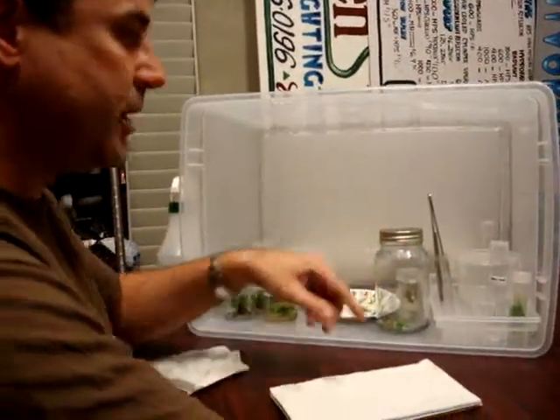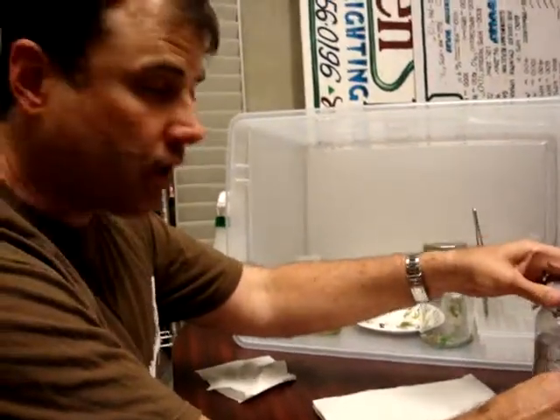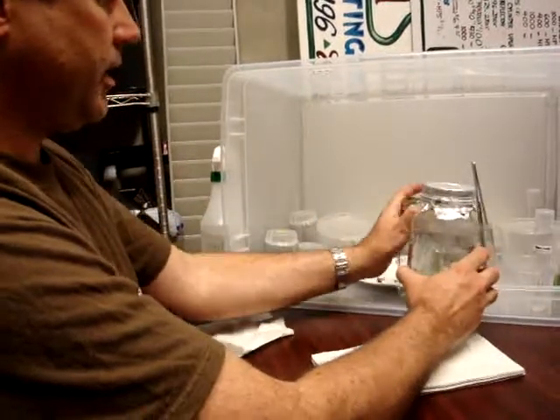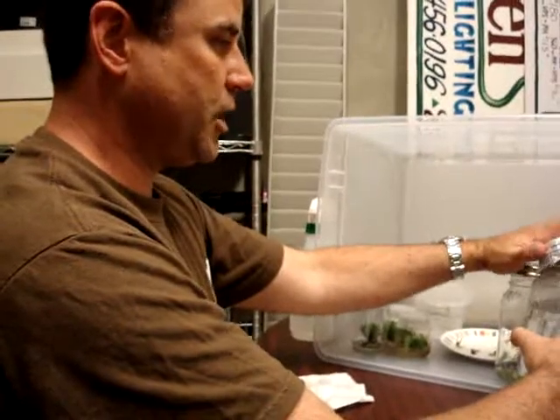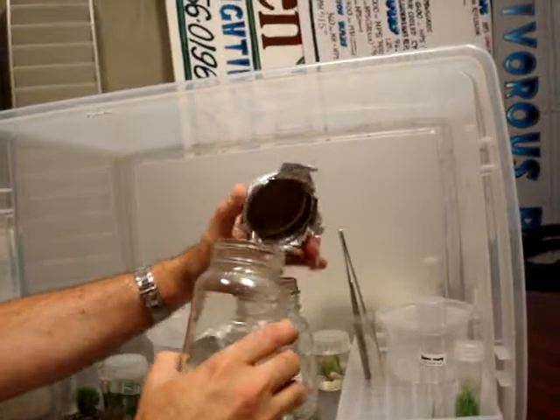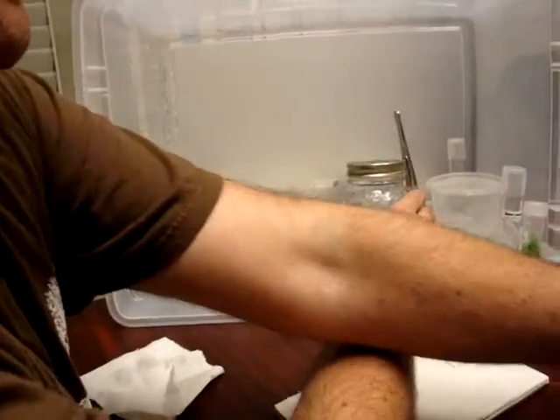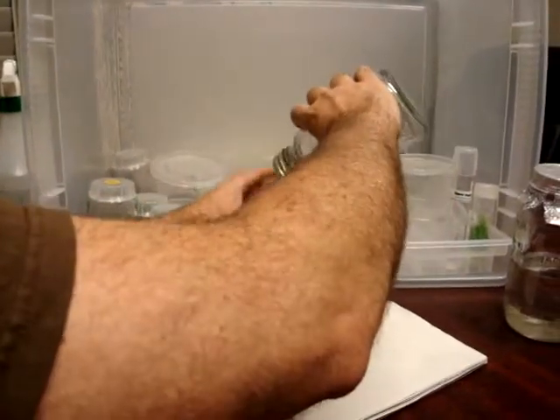Without having to pop holes in it. Exactly. So that's been drained, and now this is sterilized water — just tap water that was put into the pressure cooker when we made the jars. This is to be done in the clean area. I've loosened one lid and now the other. Watch the hands as I tilt it and pour them one-third of the jar. Cap that off, stir these guys, then drain. We're going to do this two more times to rinse off the bleach.